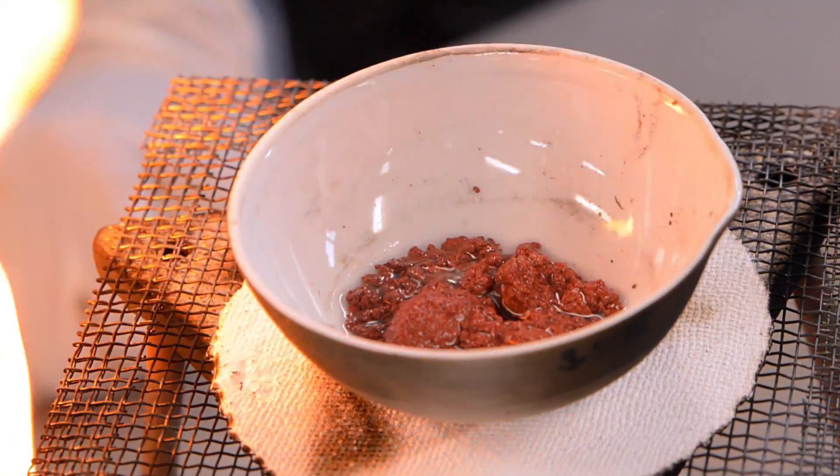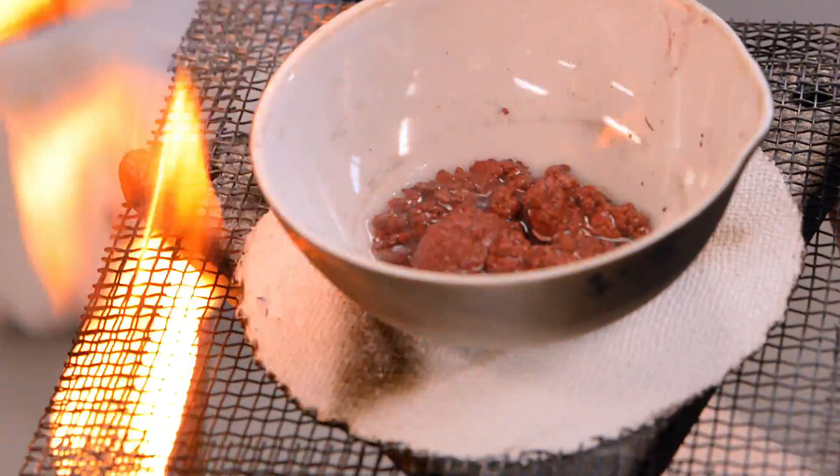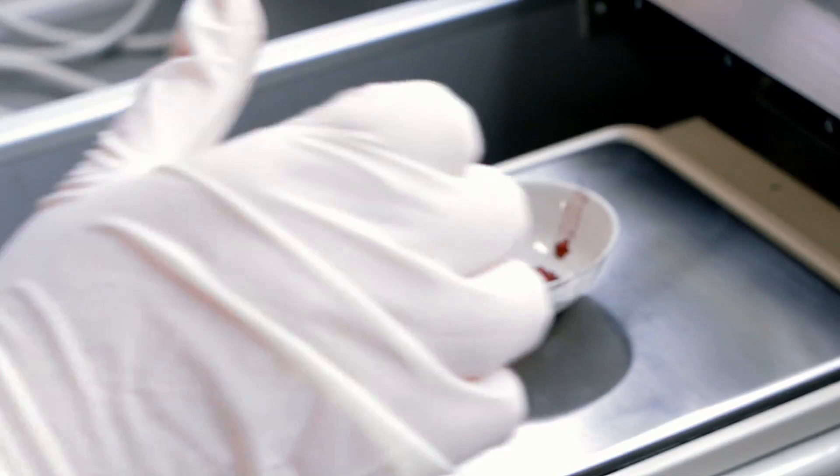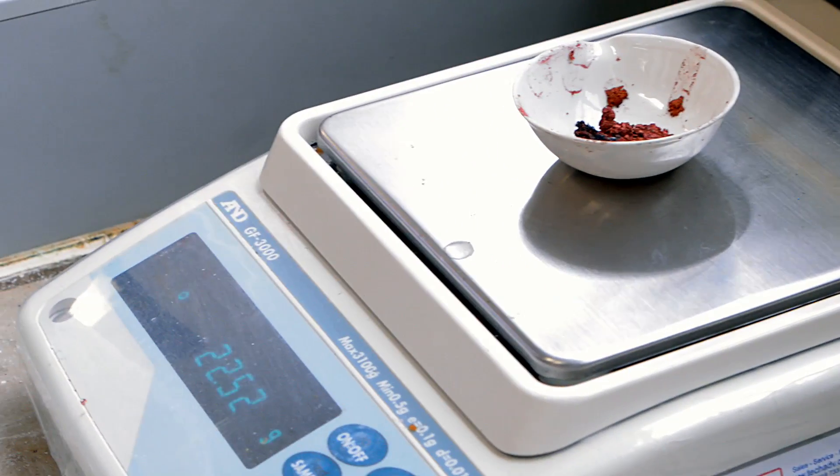Here we're evaporating it, alternating heat on and heat off so that it doesn't spit uncontrollably. Once it was dried, we weighed the resulting mass.